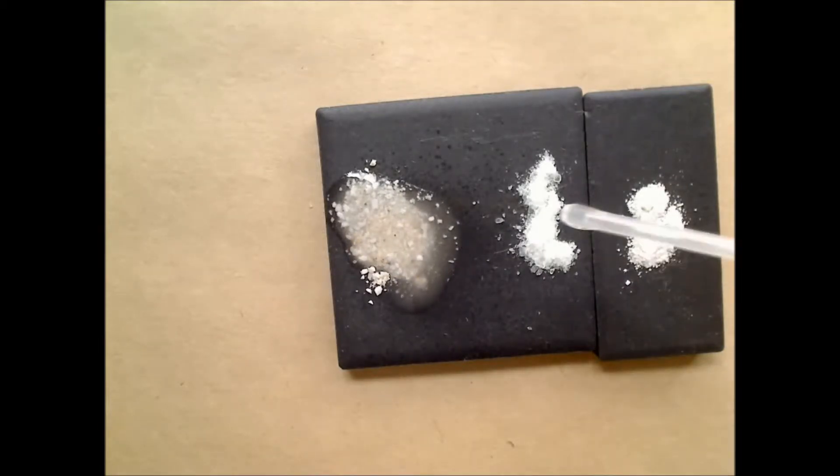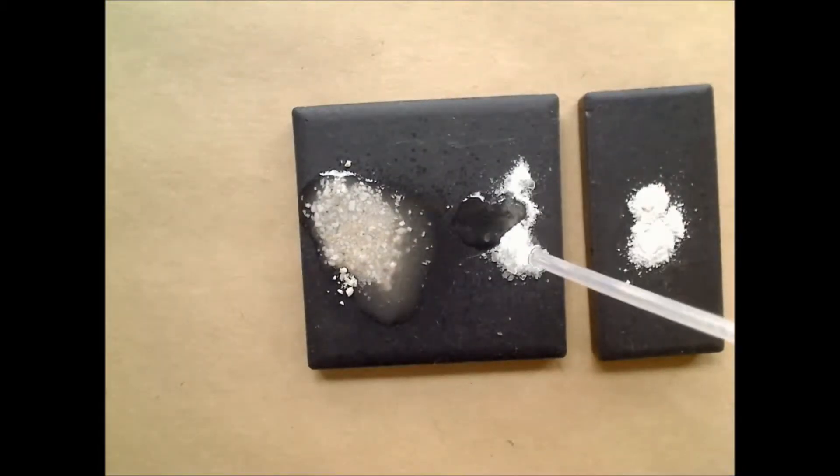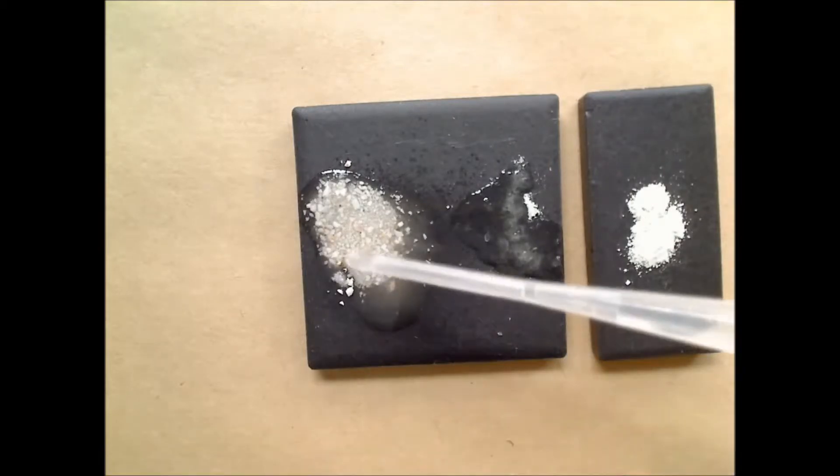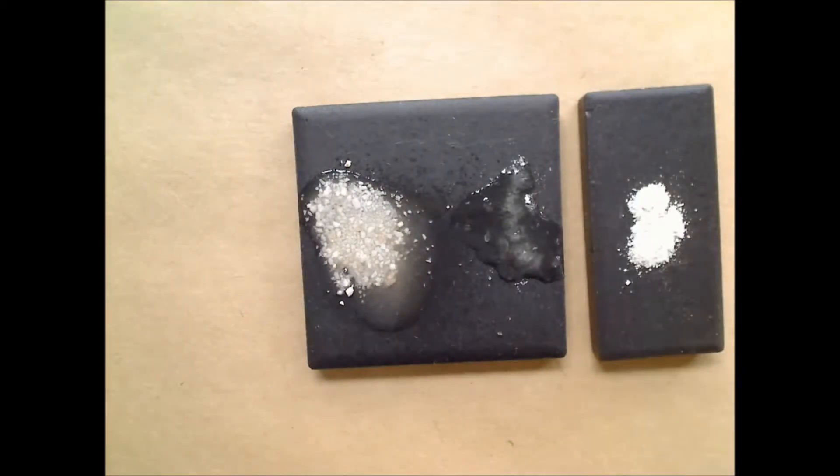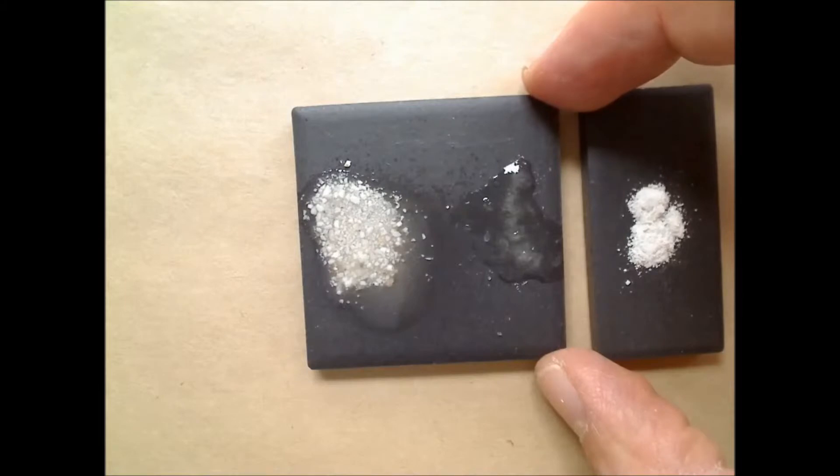Now here I have some powdered fluorite. I have some crushed up fluorite. And you see no reaction there. You can still see some reaction in dolomite. The fluorite never fizzes in acid. Dolomite didn't fizz as a solid but did fizz when crushed, and we'll get to why that is in a second.